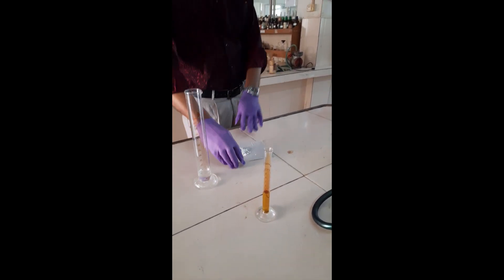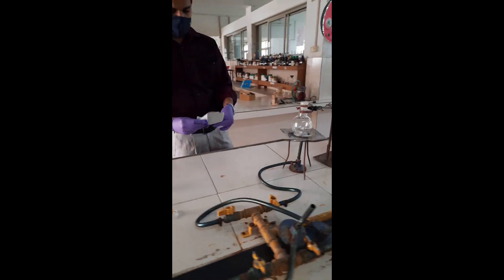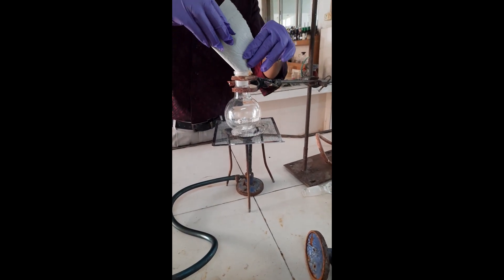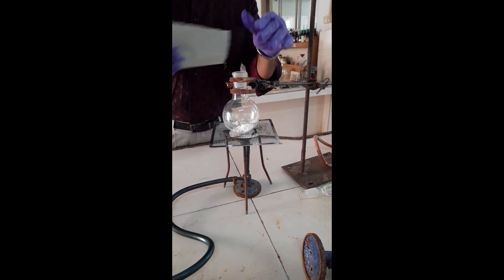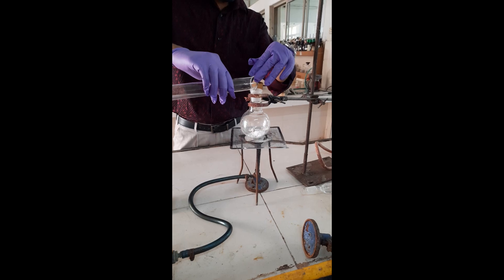Then next, add 2.5 gram of benzoin to RBF. Then add 12.5 ml of acetic acid to this RBF.